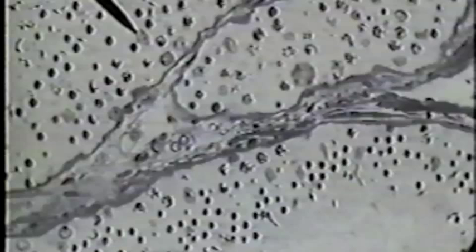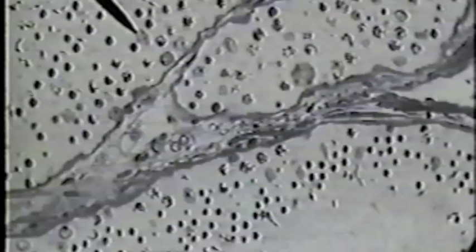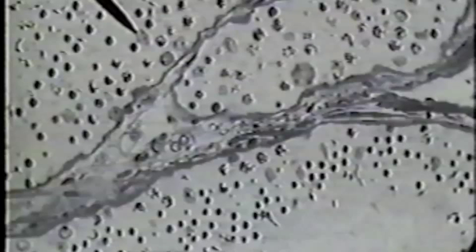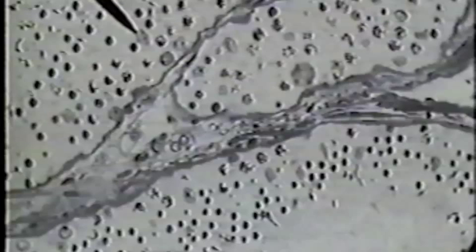This pear-like nucleus is the nucleus of a very large cell — the Sertoli cell, or sustentacular cell, that actually supports these developing germ cells. Here is another nucleus of a Sertoli cell.